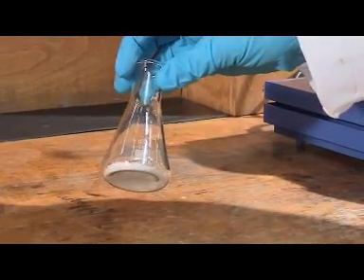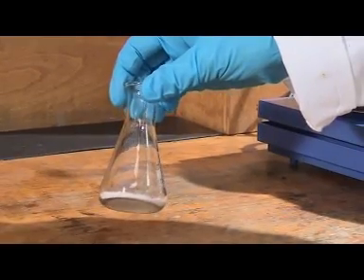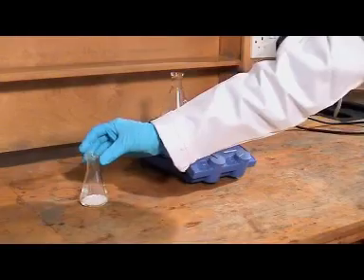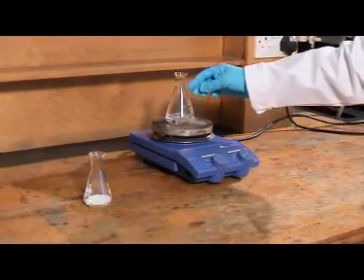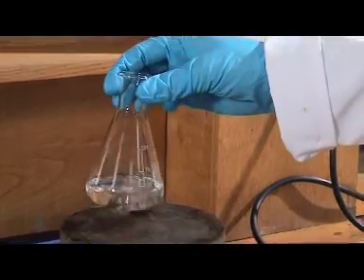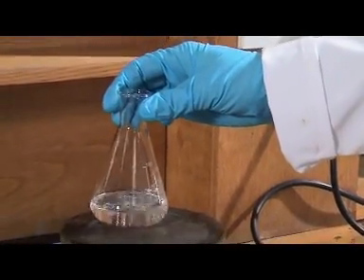This is the white solid we're going to recrystallize. In this flask I've got some anti-bumping granules. These are very important to allow the solvent to boil well.